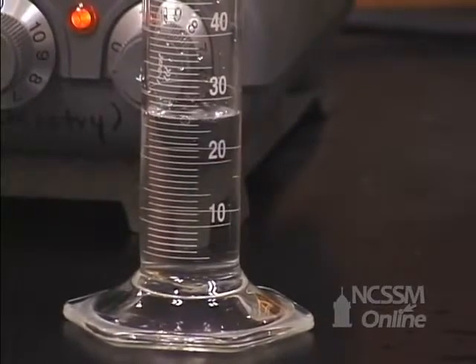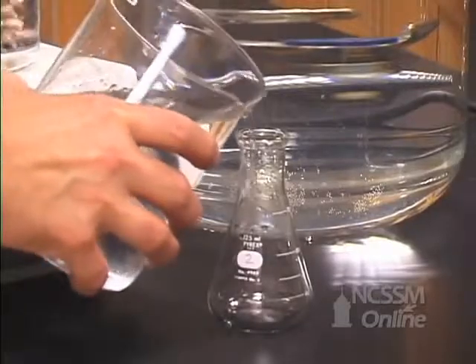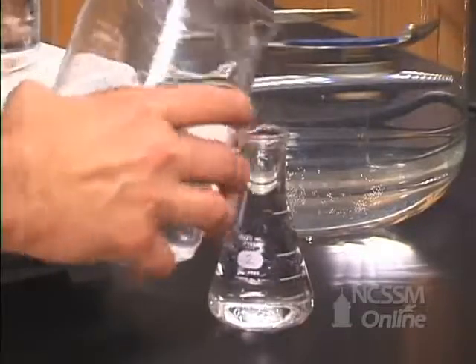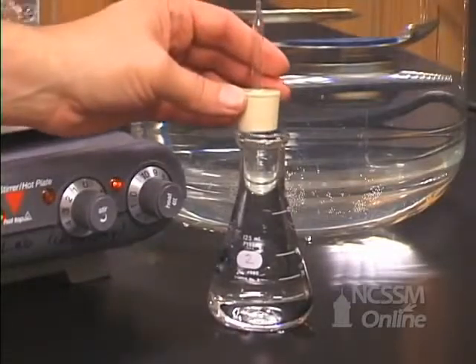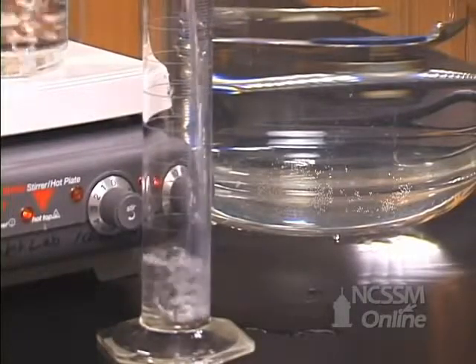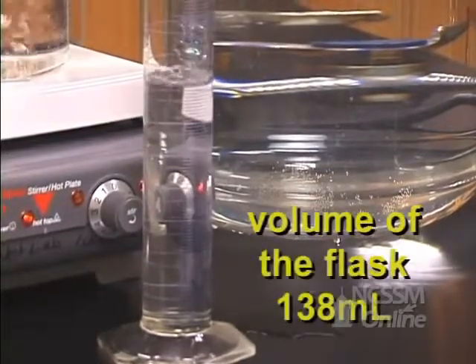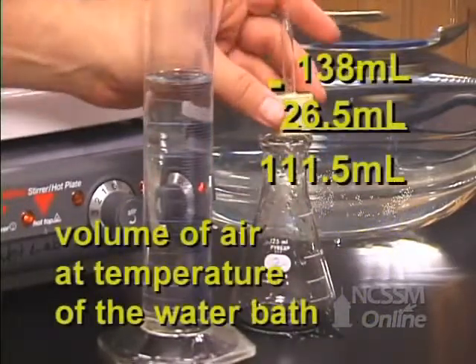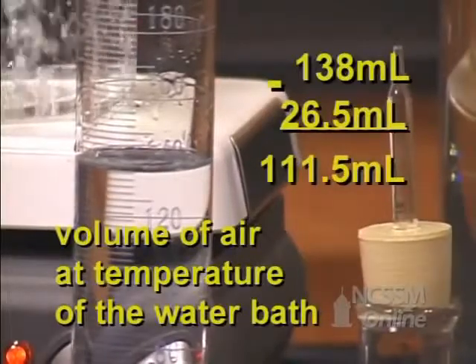The volume of the water in the cylinder is 26.5 milliliters. We will now fill the flask completely with water. The volume of the water that completely fills the flask is the volume of the air that filled the flask at the temperature of the boiling water bath. We will now measure the volume of water necessary to completely fill the flask. The volume is 138 milliliters. The difference between the volume of water required to completely fill the flask and the water that was in the flask after cooling is the volume of the air at the temperature of the large water bath.